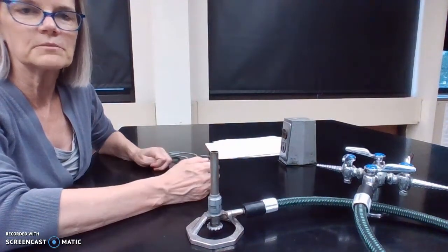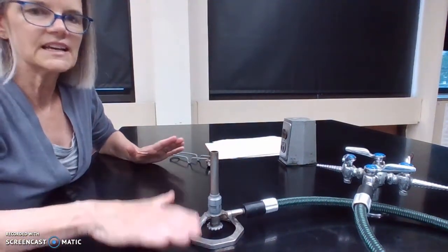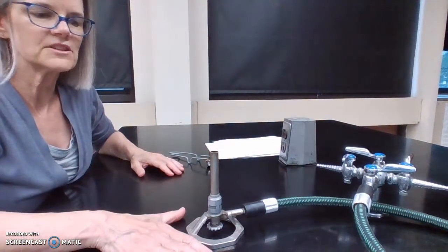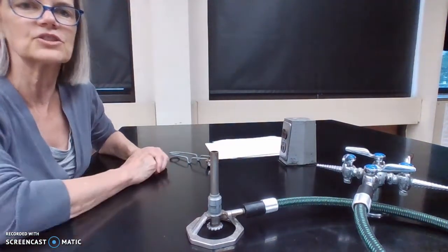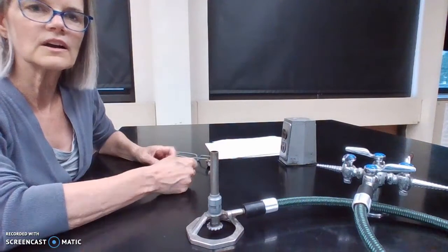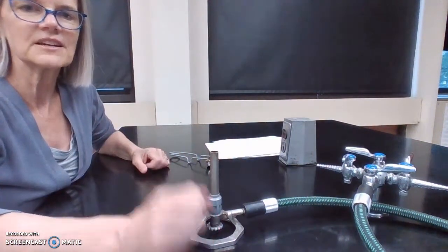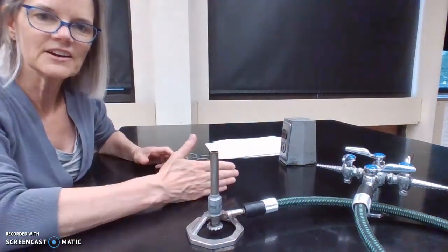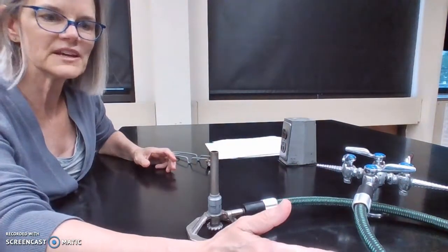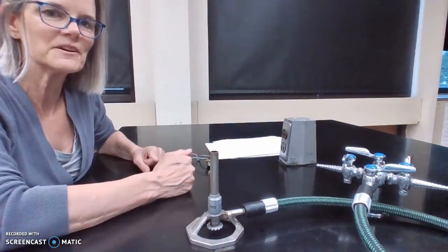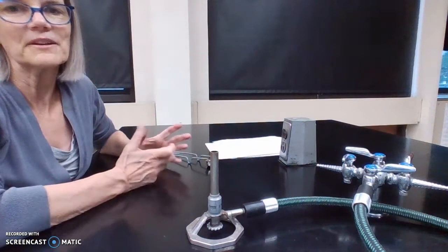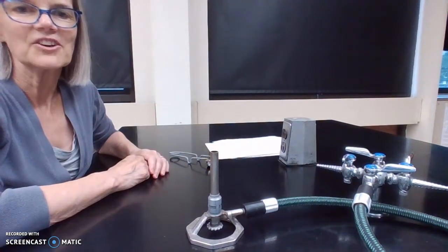So if you turn on the Bunsen burner, you need to stand near the Bunsen burner the whole time it's on and then turn it off as soon as you're done with it. Or you can hand it off to somebody by saying their name and saying, will you take the Bunsen burner? And they say, yes, I will. Good Bunsen burner safety. Good luck.